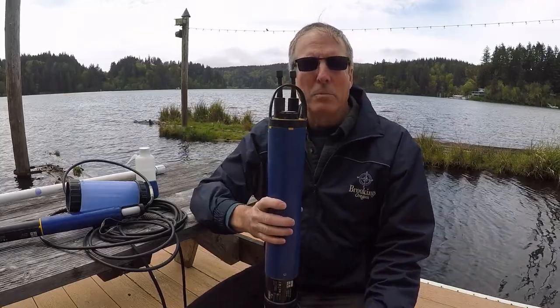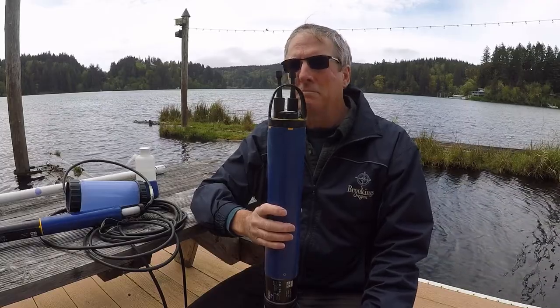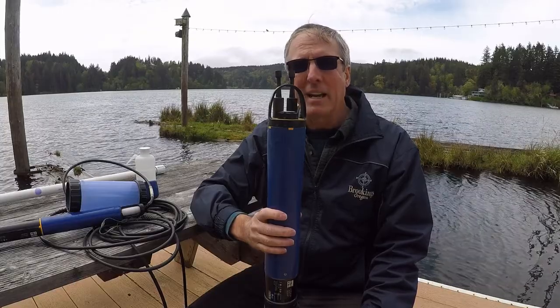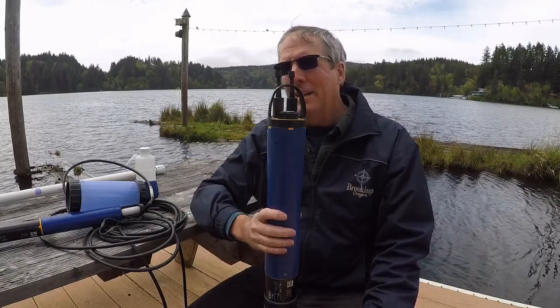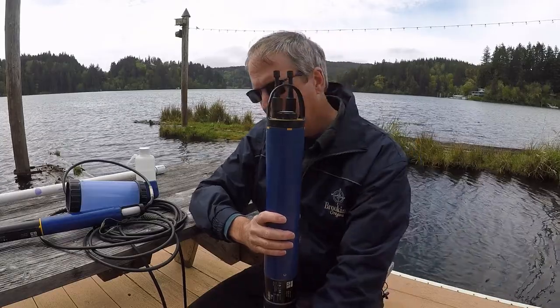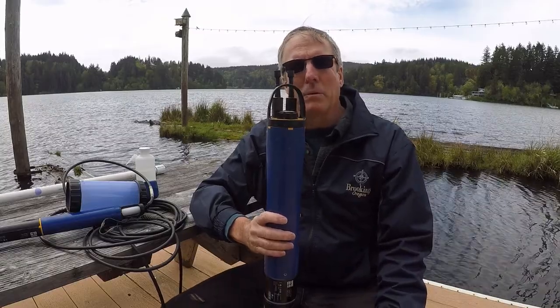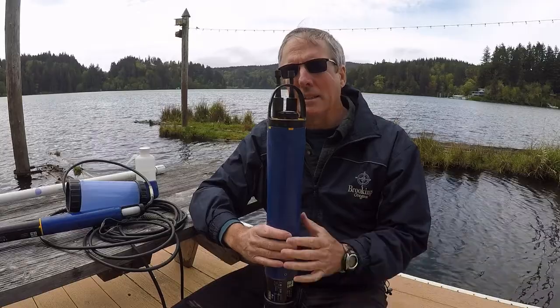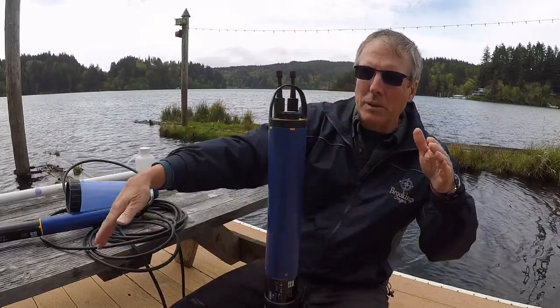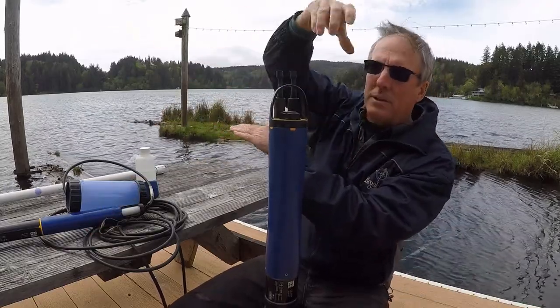I tell you, it's a little breathtaking at times when you don't catch the line right away. You know your $10,000 piece of equipment is sitting on the bottom and you've got to get it back, so it's a little nerve-wracking, but to date we haven't lost one, knock on wood. We found that the usual problem when we're having trouble grappling is that the grappling hook itself is not weighted enough, and as we're moving forward, the hook rises up and goes over the top of the line and misses it.